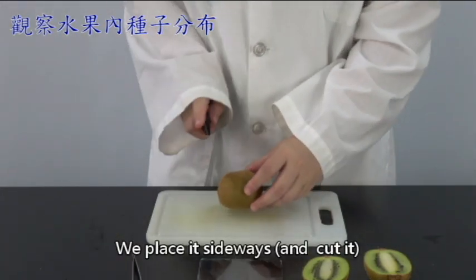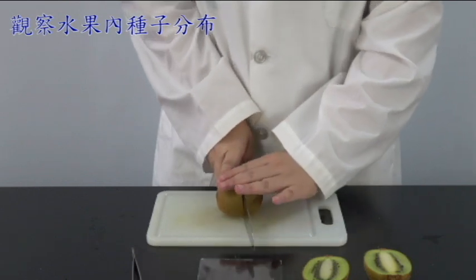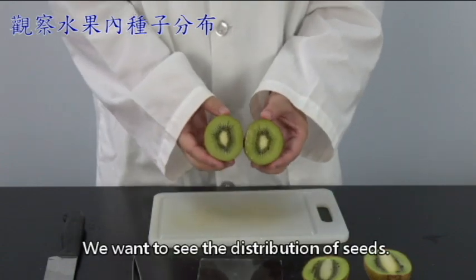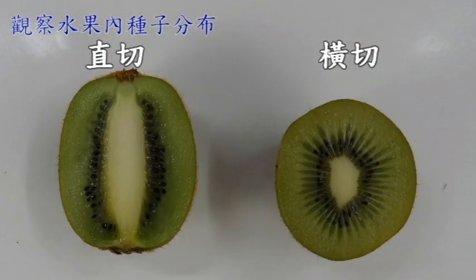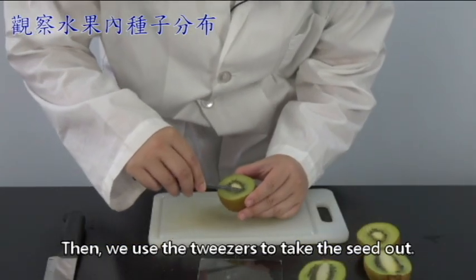We place it sideways and cut it. We want to see the distribution of seeds. Compare these two distributions of seeds. Then we use the tweezers to take the seeds out.